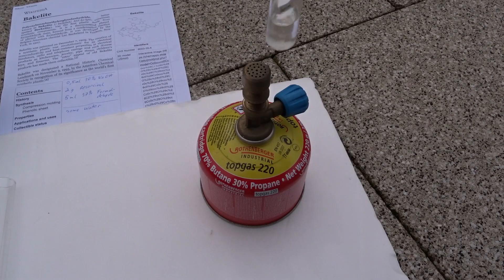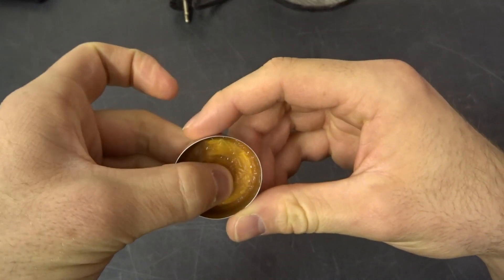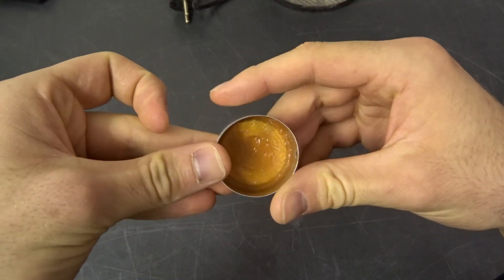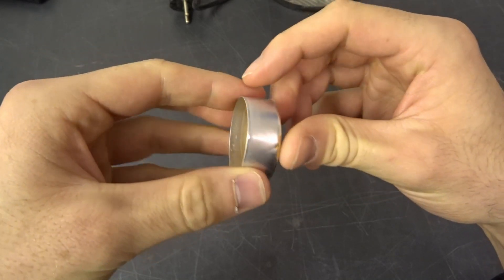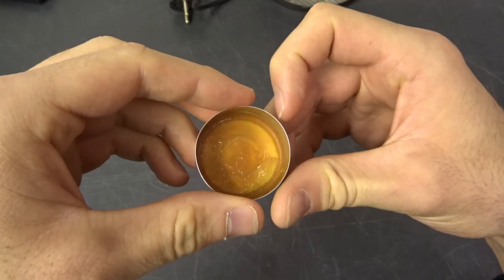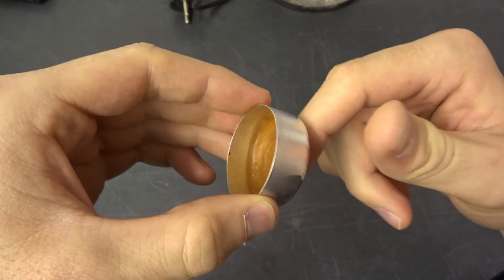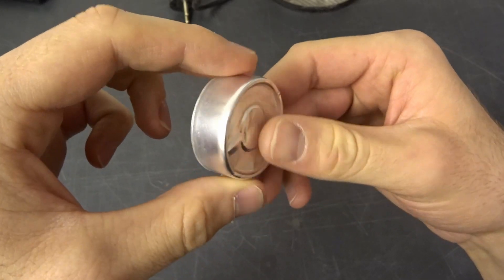So too high a concentration of sodium hydroxide. Instead it should stay clear for quite a while and you should be able to boil a lot of water off, like this example. Here there is almost no water left and it's not like a gel — it's not squishy and gooey. Instead it's a solid orange paste which is about halfway cured and not a deep red, which means it's fully cured. So the concentration here was about 7%.